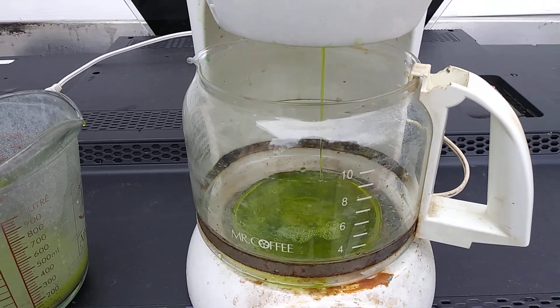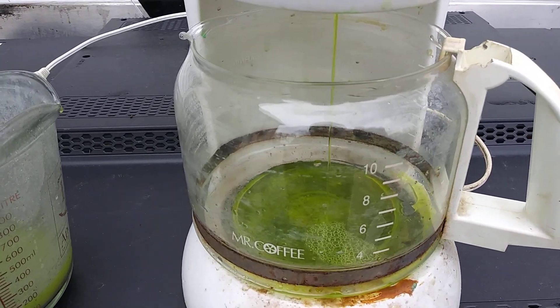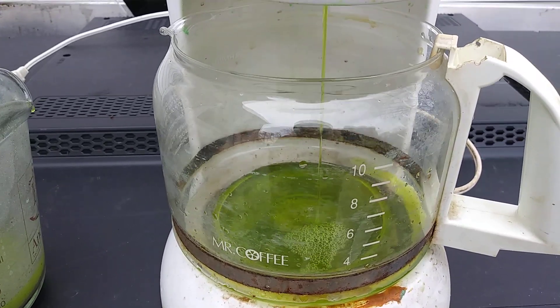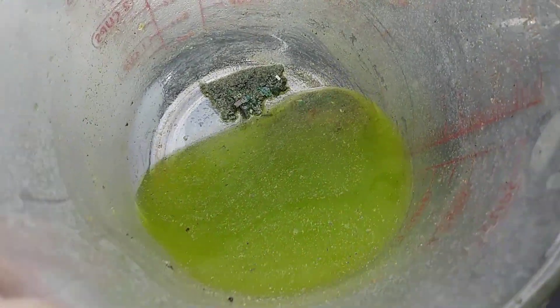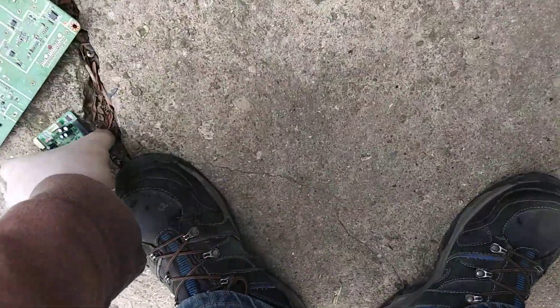This is just pretty much the process right here — just like waiting for a pot of coffee to brew. You can see here how much I already pulled. I can feel that debris in there. That's all pieces of circuit board, like the green that comes off of them. And sometimes something green will come off.